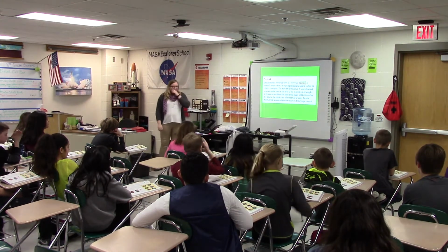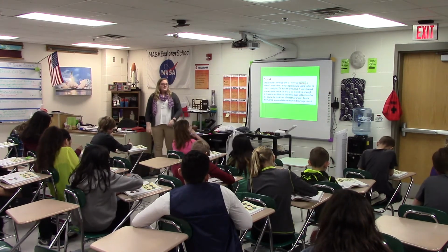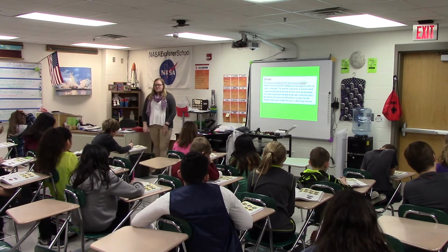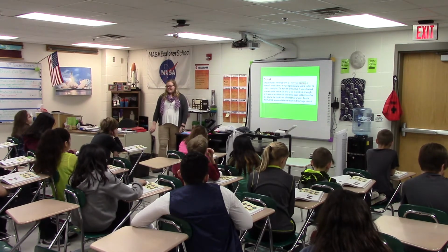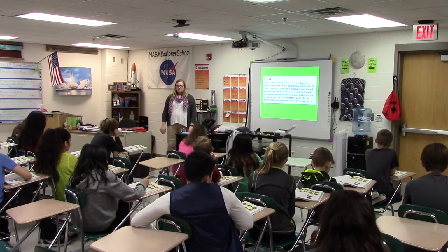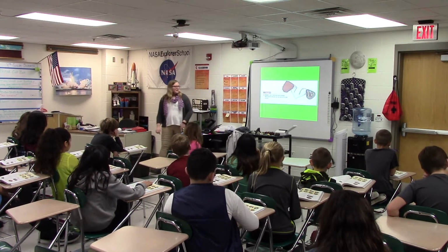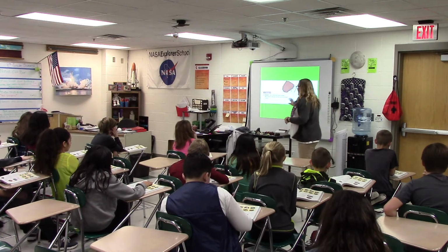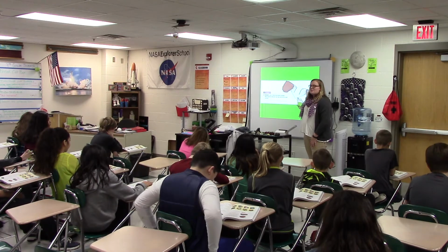So in our book, we are going to underline the color of the powdered form of mineral. That is its streak. And make sure you box in streak there. Remember what I said, we have these two minerals up here. They have the same streak color. They might not be the same mineral. So don't just base it off of that.